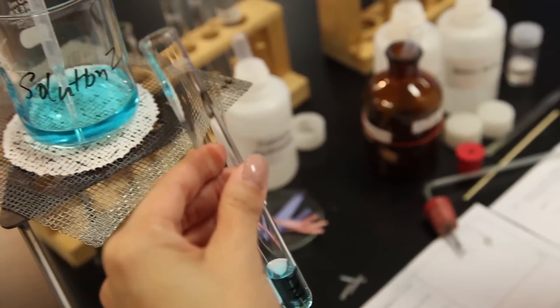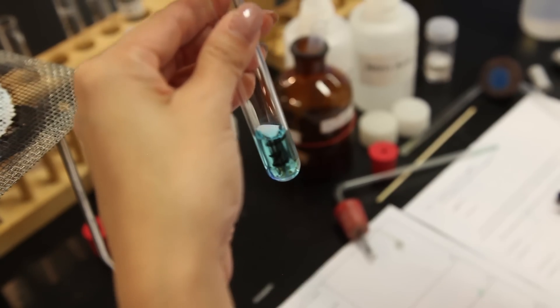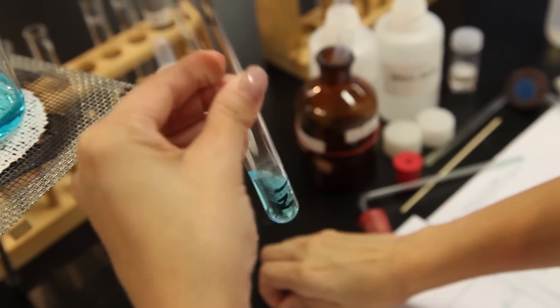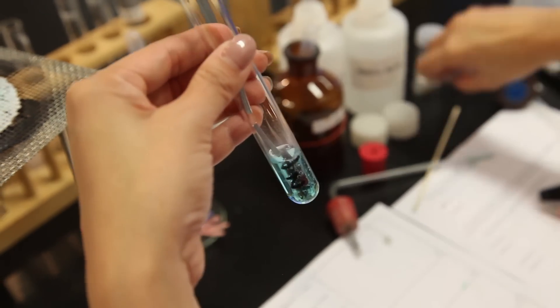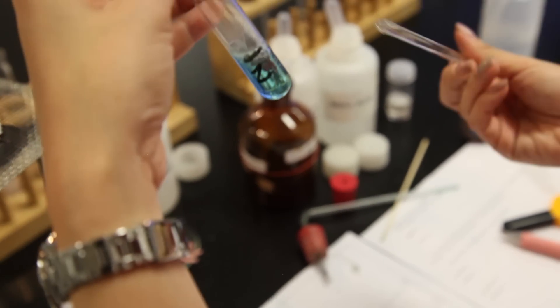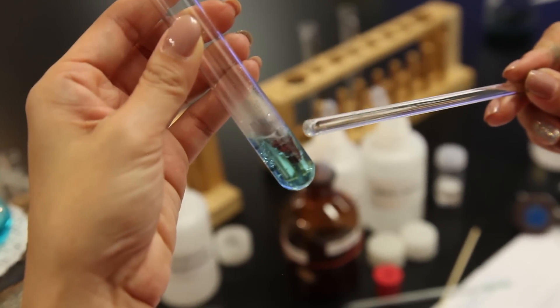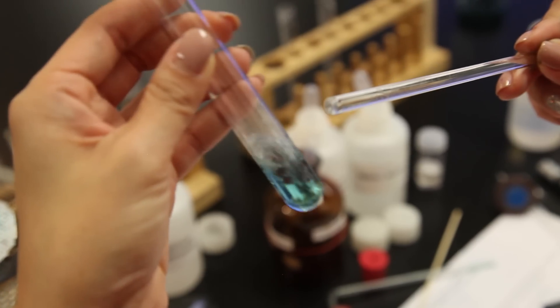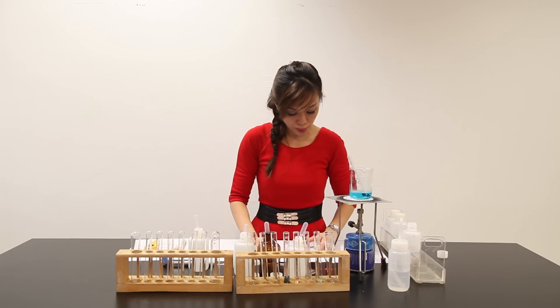Part D says to add about 2 cm³ of Z with three pieces of magnesium strip. Effervescence is observed, and a red solid is formed above the magnesium. I'll put this aside to observe in a few minutes.